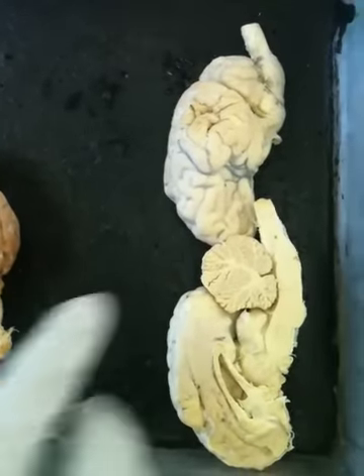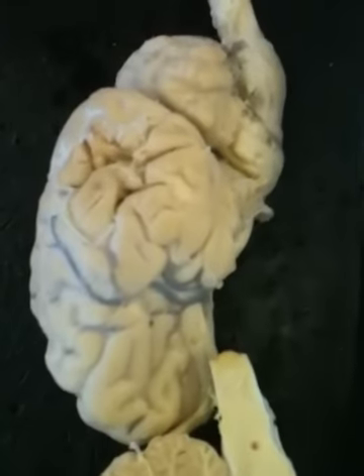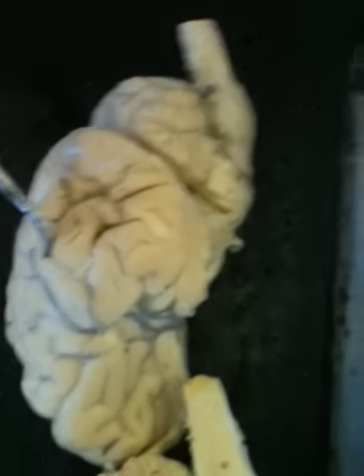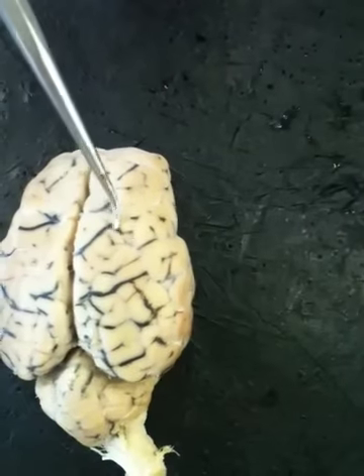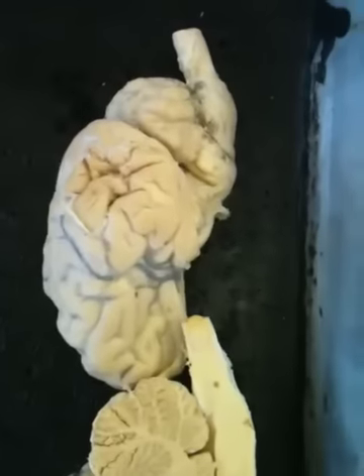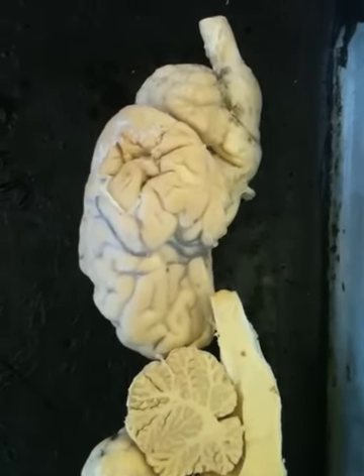On the sheep, you can see in this model the arachnoid mater, which is this white sheath, and notice the black lines both in this one and in this one. Those are blood capillaries that are found within arachnoid mater. The third layer is pia mater. It's not on the list, but he might say something, I don't know.